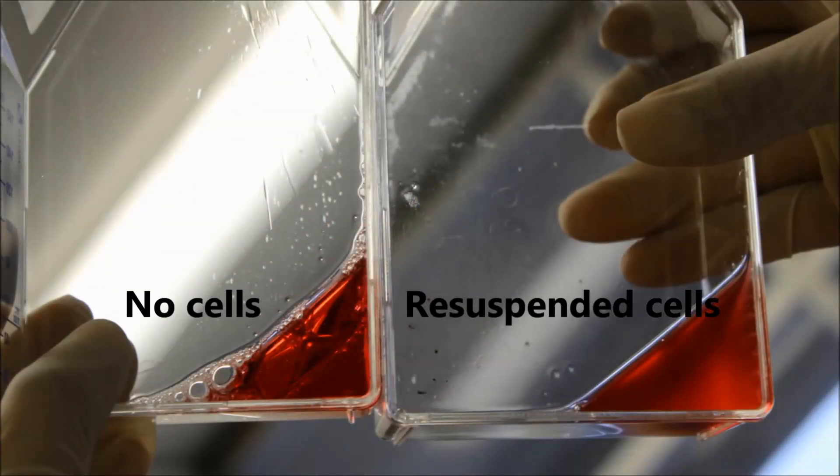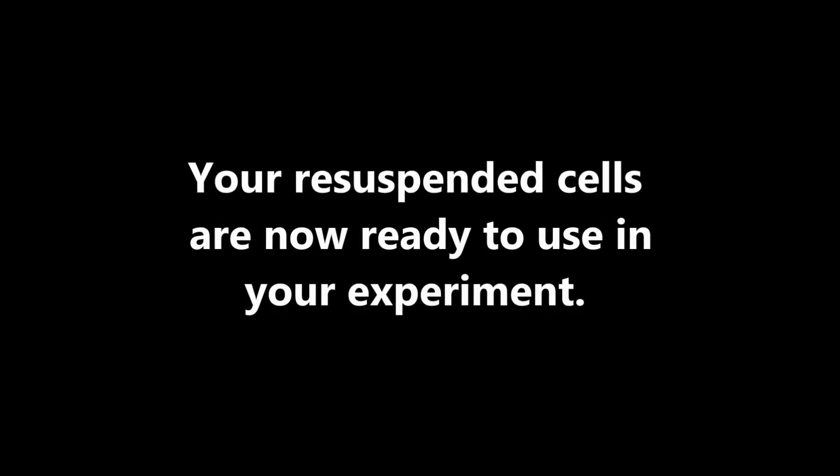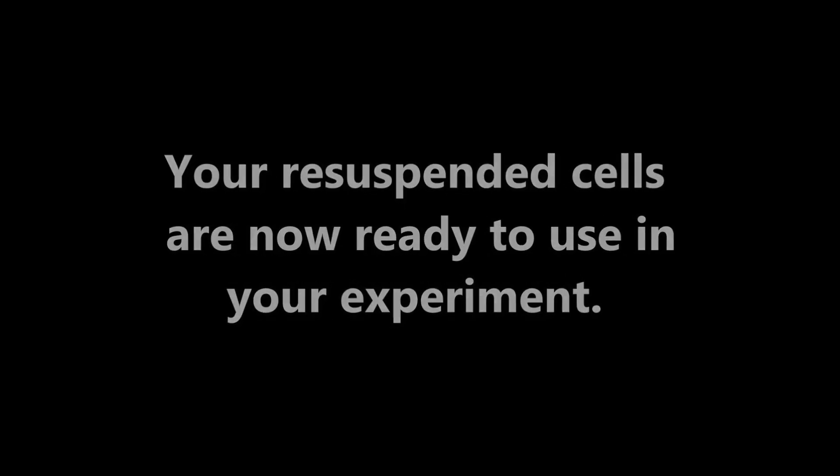Notice the difference in turbidity between your resuspended cells and media with no cells.